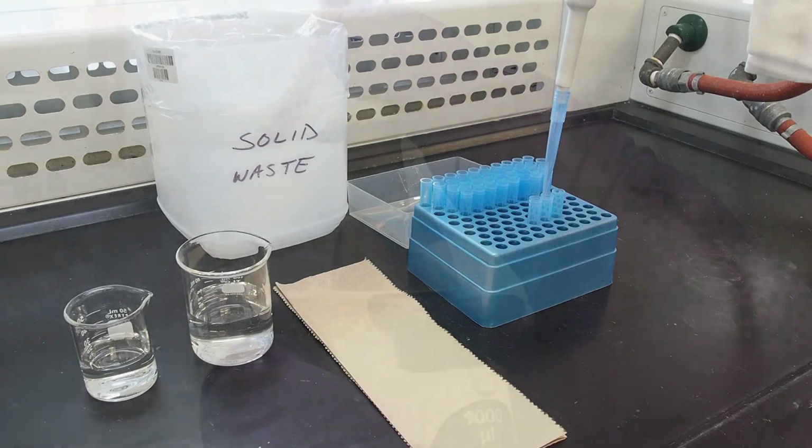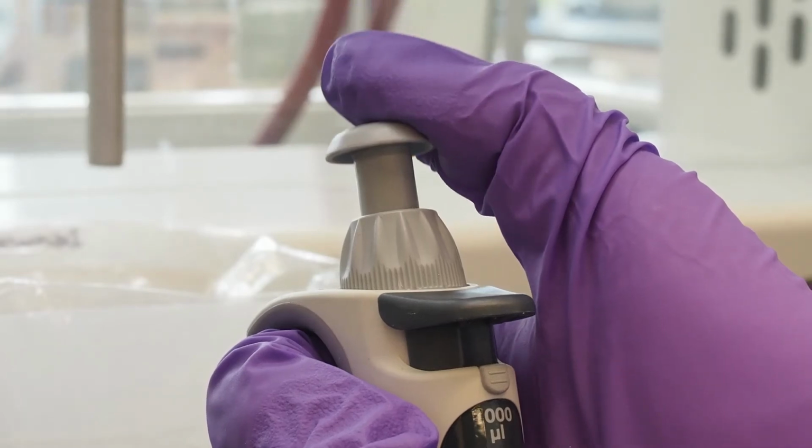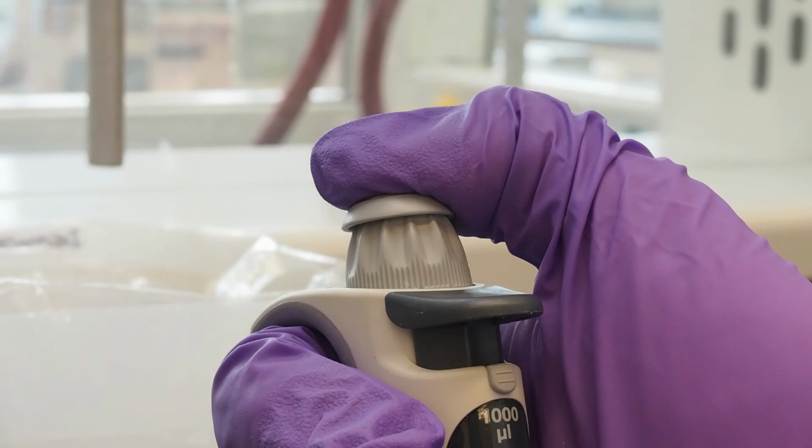With the pipette tip in place, let's examine how the pipetting button works. There are two stops that can be felt when depressing this button. The first stop that's felt is used to both draw liquid into the tip and also to dispense liquid out of the tip when you are ready to perform the transfer. The second stop that's felt is only used to completely expel the tip of any liquid once the majority of the liquid has been dispensed after depressing the button to the first stop. This is referred to as the blowout stroke. We'll be seeing this in action very shortly.